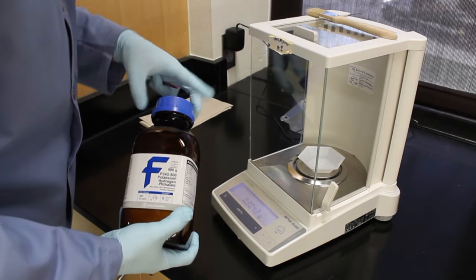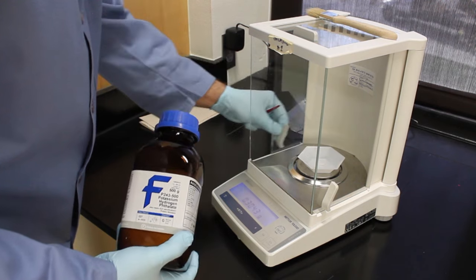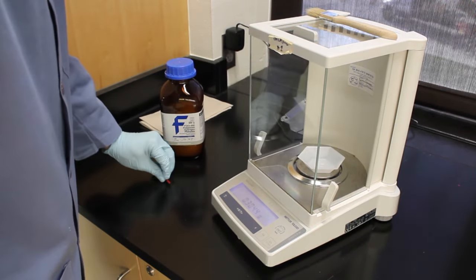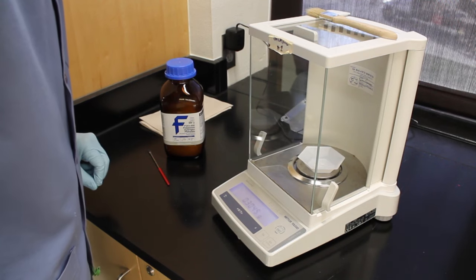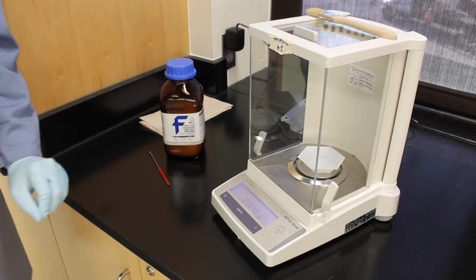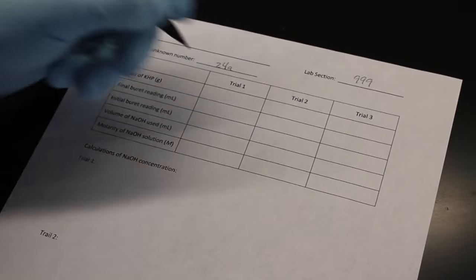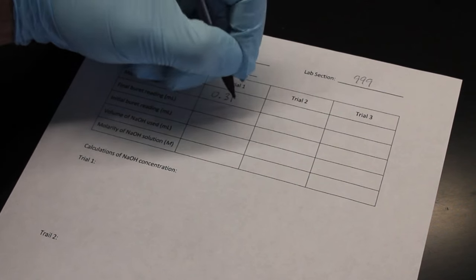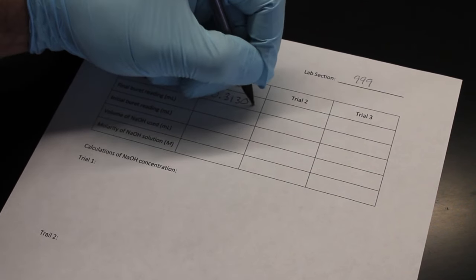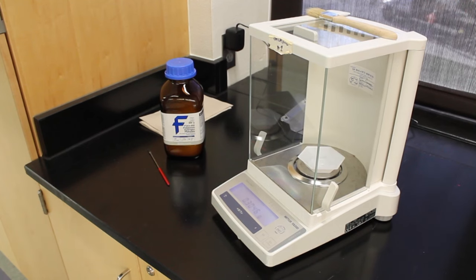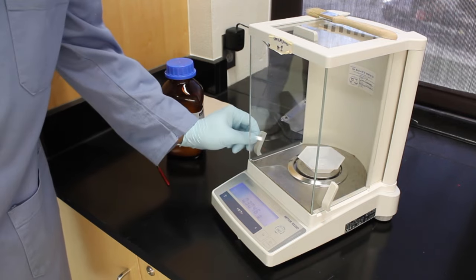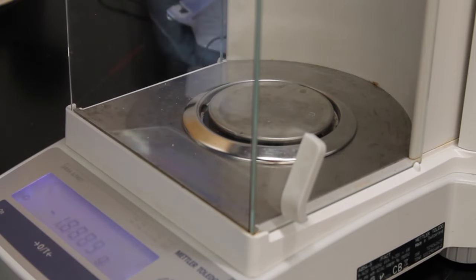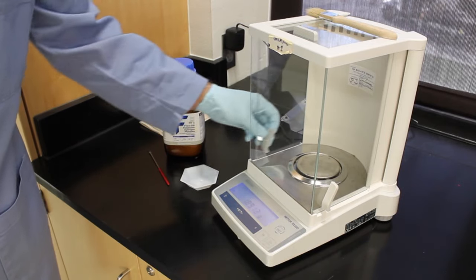If you are using this style of balance, make sure to slide the door closed to get your final mass. You will need to document your KHP masses each time you take one. I recommend you weigh out 4 separate boats of KHP for your titrations, but really it's up to you on how many you do. Make sure the balance is clean when you are done with it.